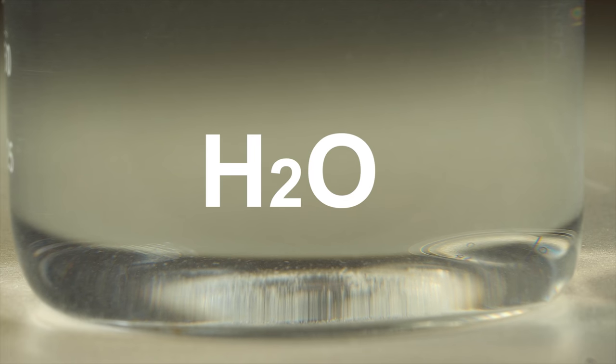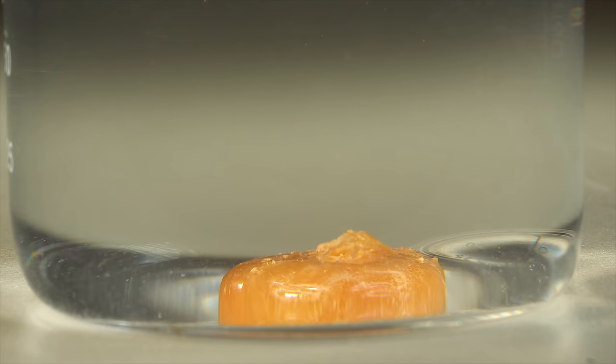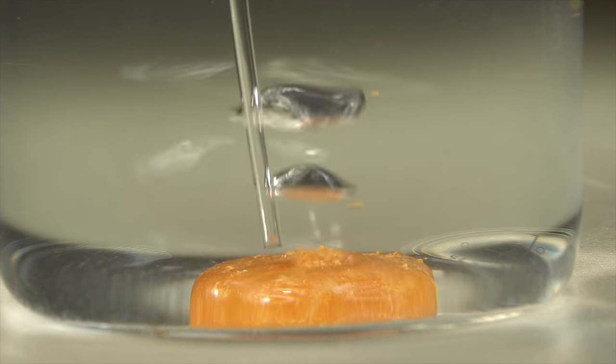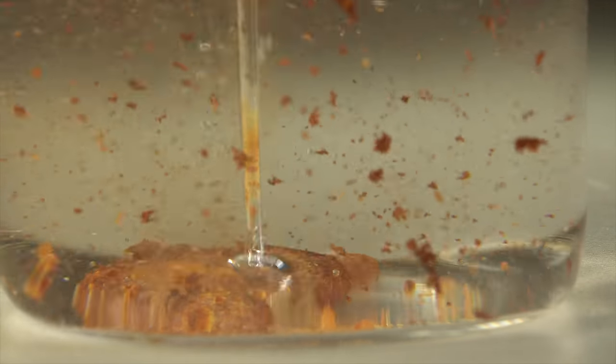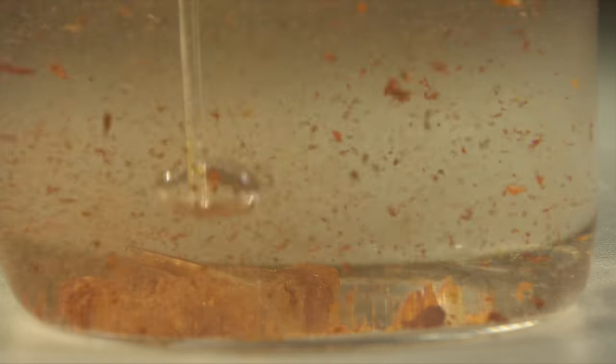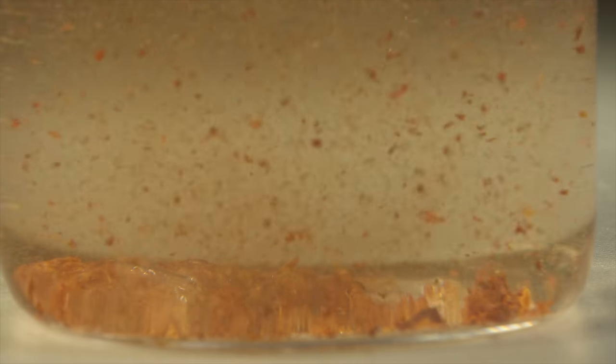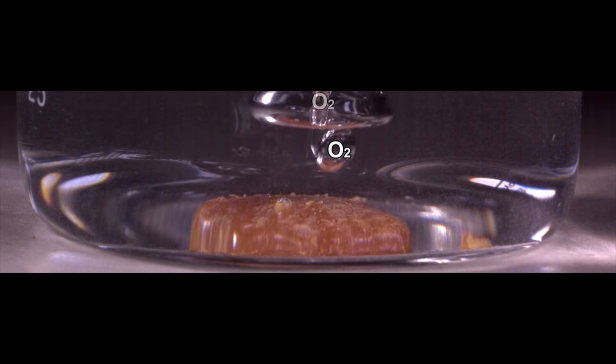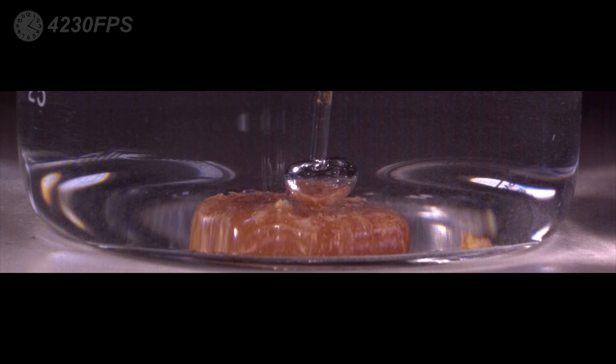You probably know that white phosphorus can ignite underwater if it has air or oxygen flow attached to it. This causes white phosphorus to dissolve, forming phosphoric acid. Actually, white phosphorus doesn't ignite underwater per se, it does in the area of a gas bubble it interacts with. To completely understand what it means, take a look at this reaction in slow-motion.